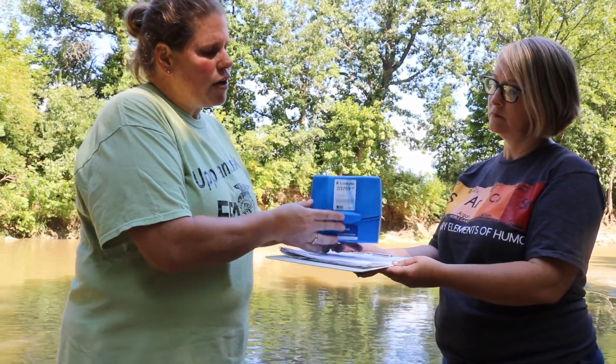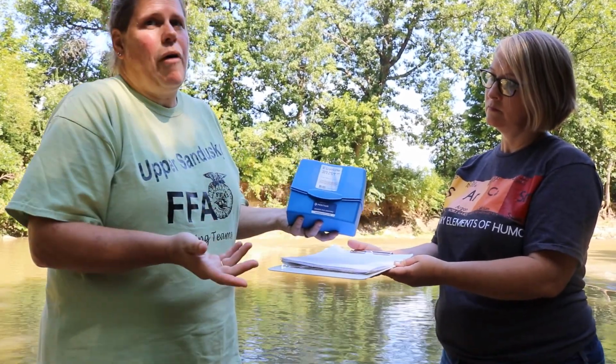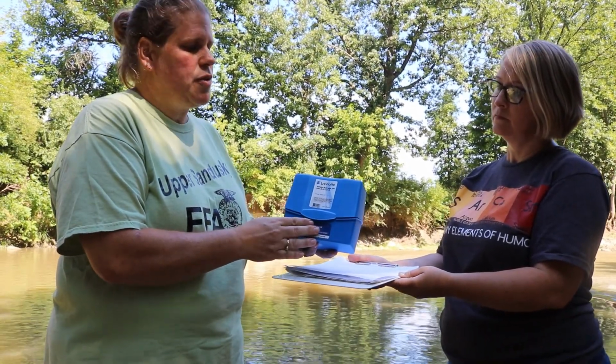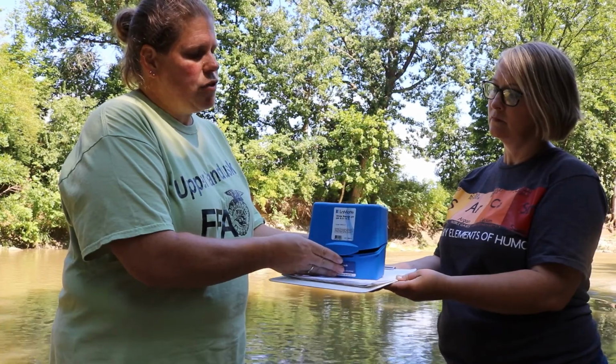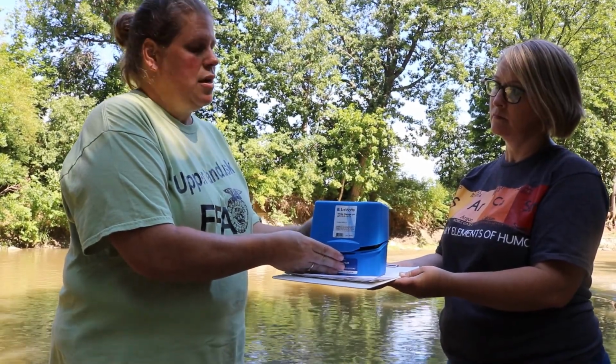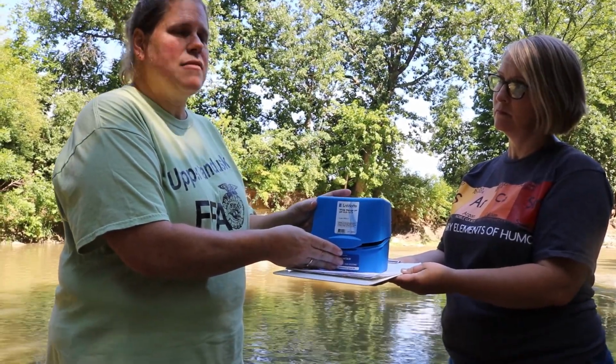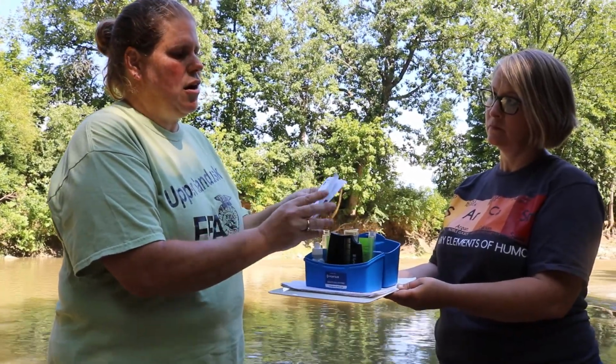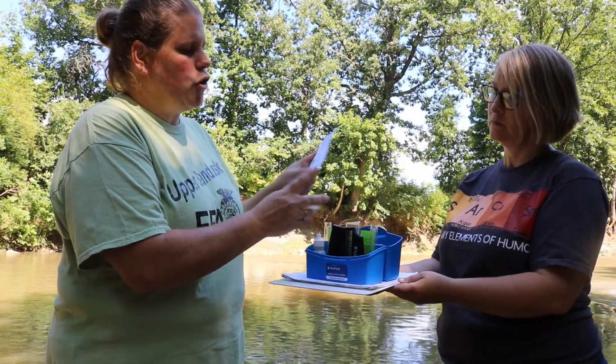So there's different companies that have test kits. I use LaMotte. It's just something I've always used. I like them. There's Hach systems, there's other types, but they're pretty easy to use. And so first test we're going to do is pH. pH is a test of acid and alkalinity. And so it's a basic color test. There's instructions in here. It tells you exactly what you need to do for your particular test.